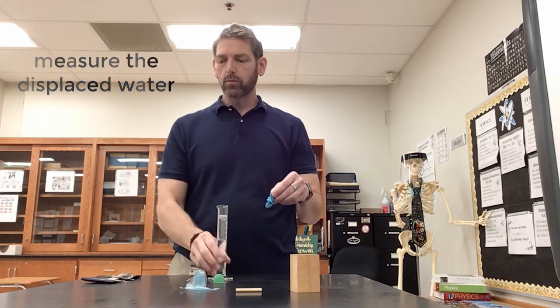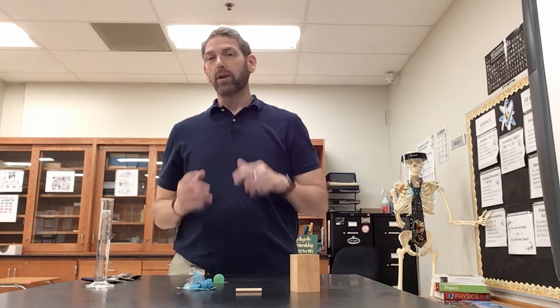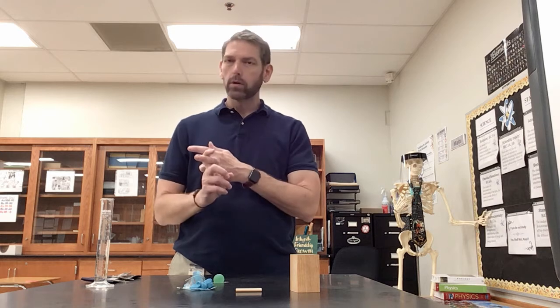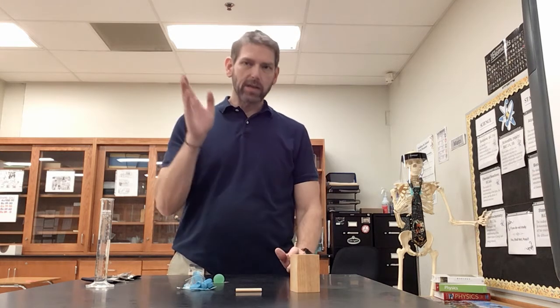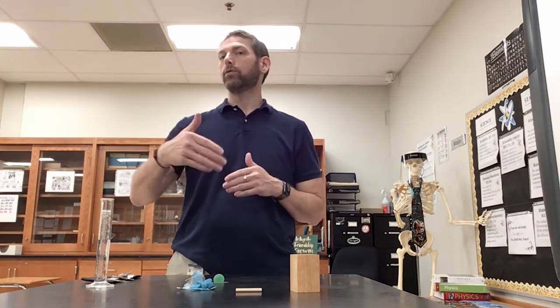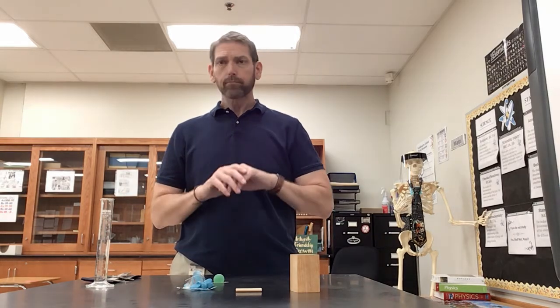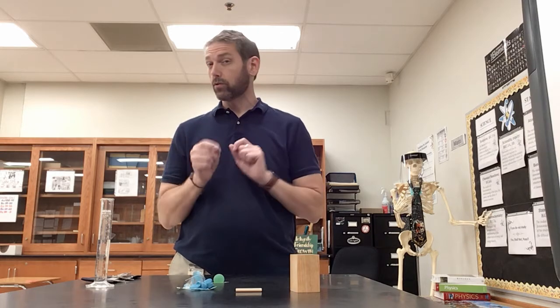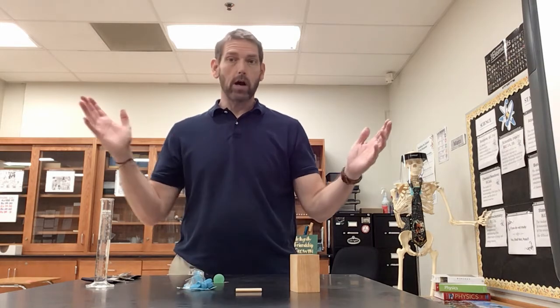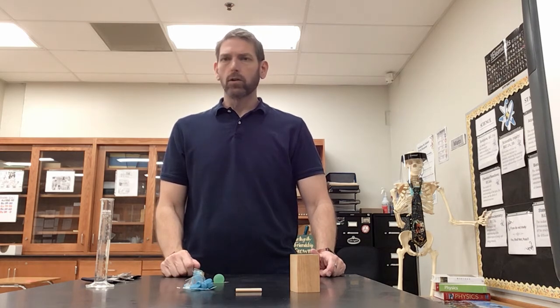All right. So in lab, this is the type of stuff that you're going to be doing. What you have to make sure you do is that your significant digits, your accuracy, and your precision is spot on. You want to make really good, precise, accurate measurements every single time, because any measurement you take that you then put into your calculation introduces error that you want to avoid. All right? And so the stuff that you're going to be working with in lab, there are basic known values, and your job is to figure out those known values for what I give you for the different objects that are there.